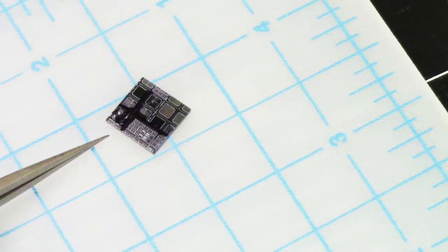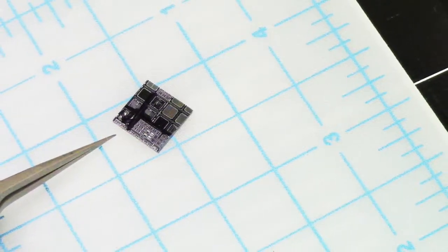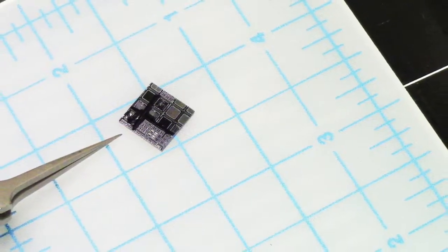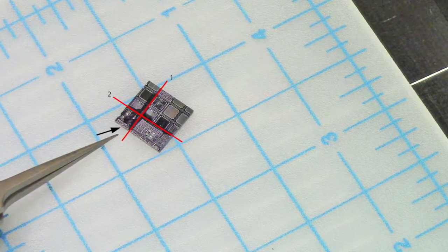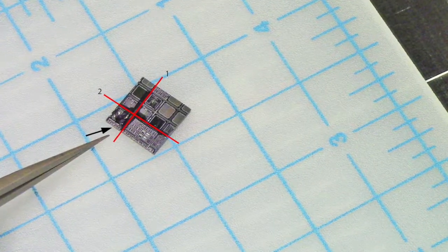We'll first mark the sample with a sharpie. The sharpie marks clearly show the side for SEM examination as well as the lines for cleaving.